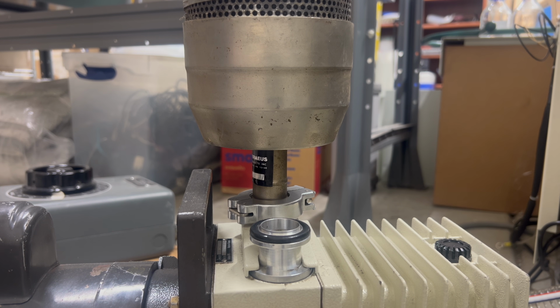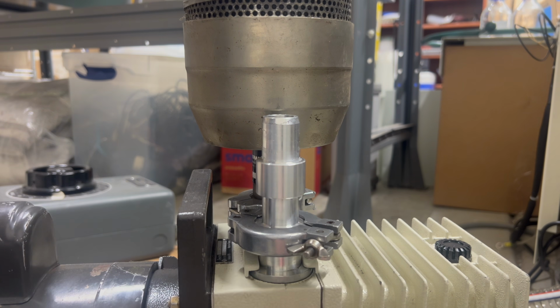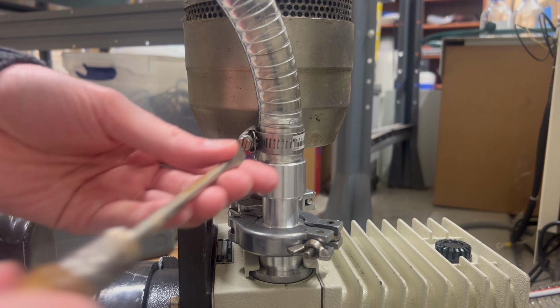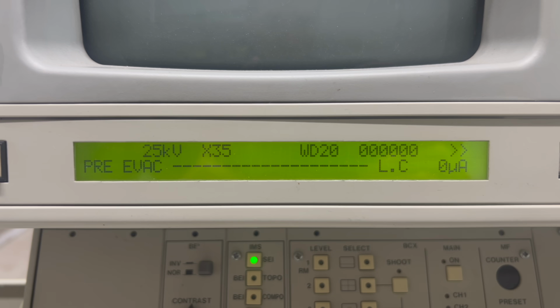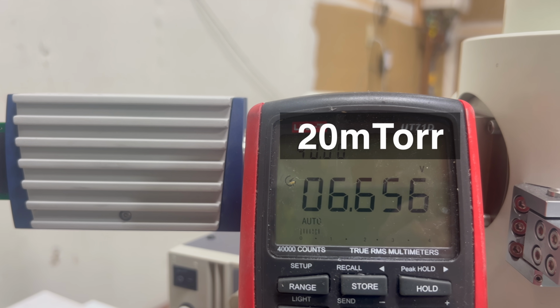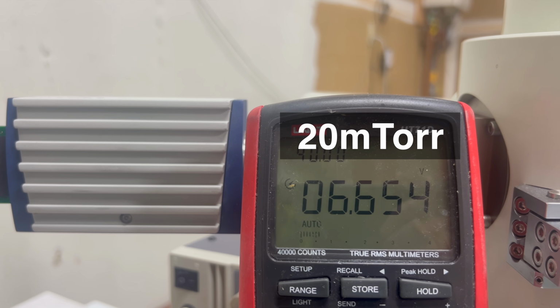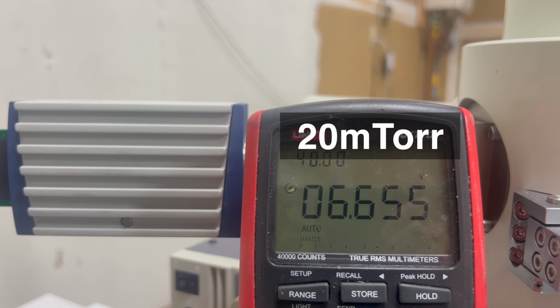I used my lathe to build an adapter from the vacuum pump's KF25 output to a 24mm hose barb to match the rest of the tubing and connected it to my SEM. This time, when I turned everything on, I watched as the pressure dropped well below the 200 millitorr from before, all the way down to about 20 millitorr. Finally, the vacuum leak has been solved and we can move on.